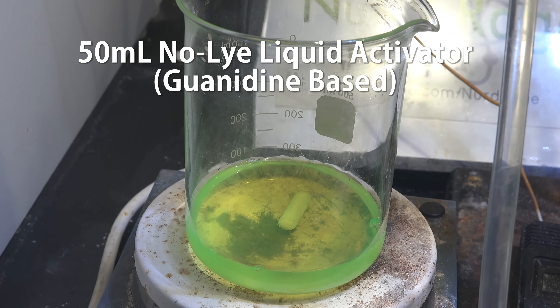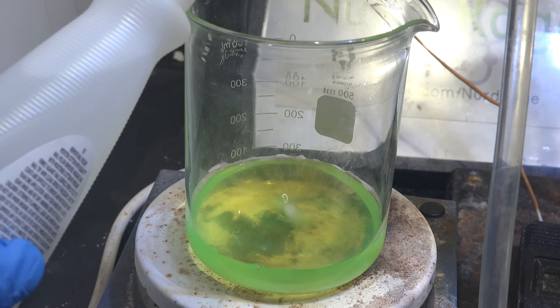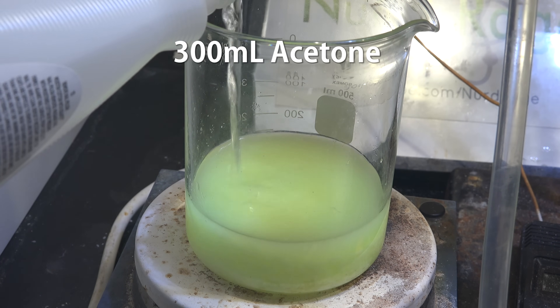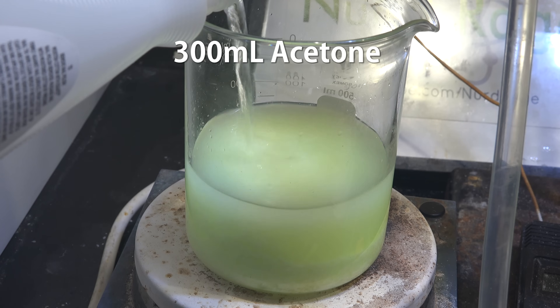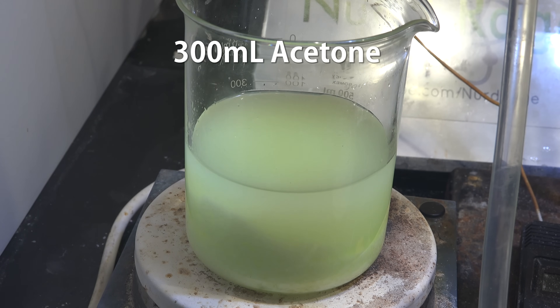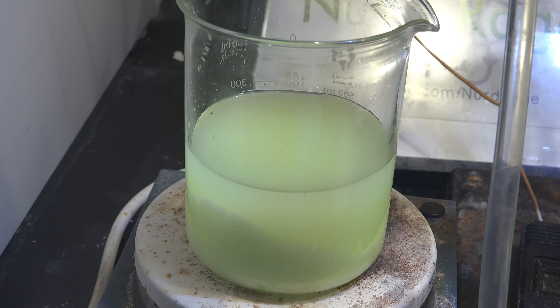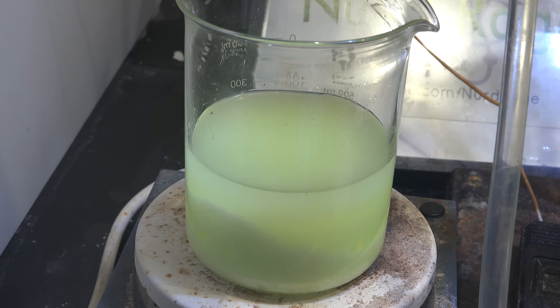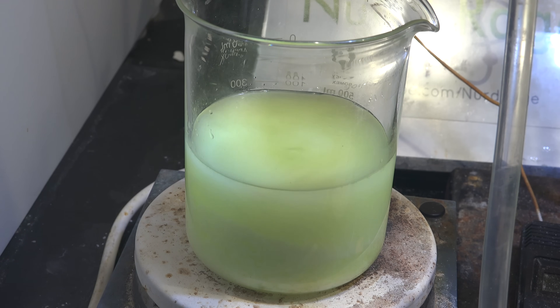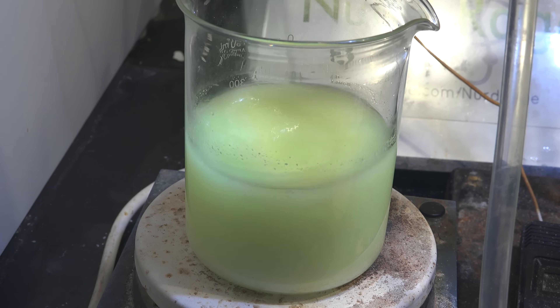The guanidine is all dissolved in solution, so to precipitate it out we add six times its volume of acetone. Since the starting volume was 50 mL, I'm using 300 mL of acetone. In keeping with the theme of using stuff from the drugstore, I'm using a bottle of nail polish remover. As we add it with stirring, the guanidine carbonate precipitates out as it is insoluble in acetone.